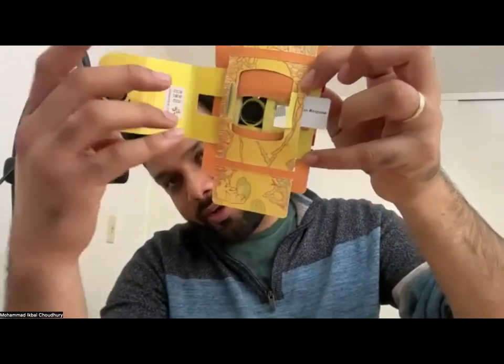Also, make sure that the sample is always down, closer to the lens. I make that mistake all the time. My sample is up and then I realize that I can't see, because it increases the distance between your lens and the sample. I've got my slide in place, but I can't see the sample.